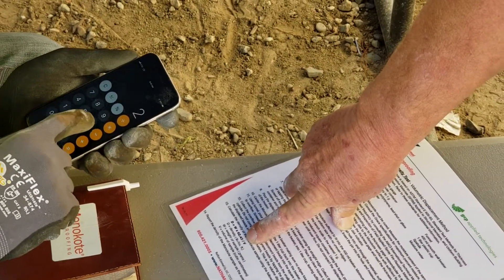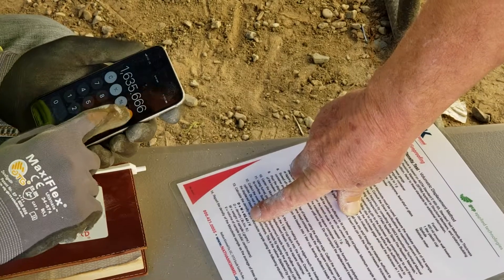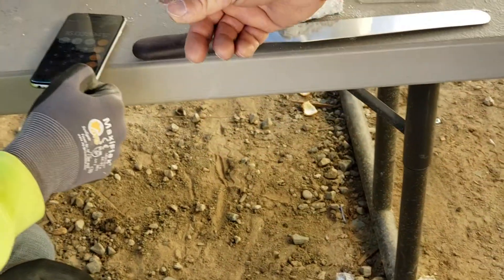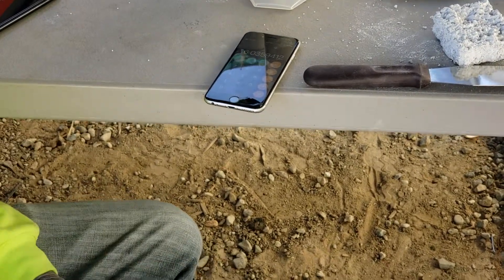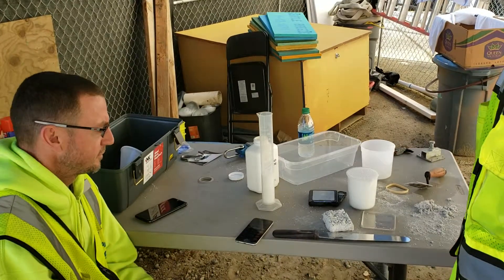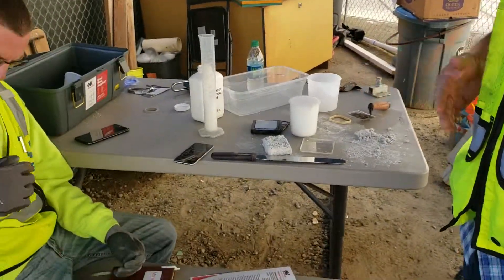That comes out to 16. We're looking for a minimum of 15 — as low as they can go, as high as they want. Our minimum is 15 and we got 16, so we're doing good. And that's how you do the bead displacement method for density.